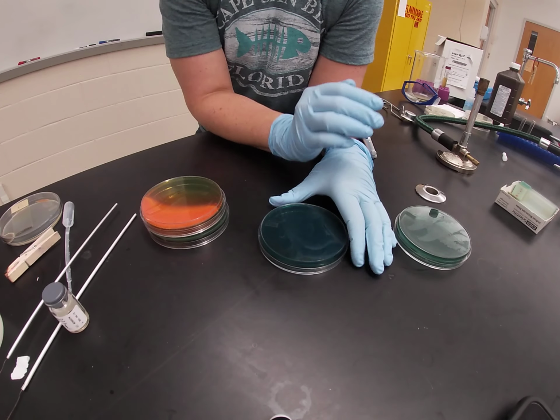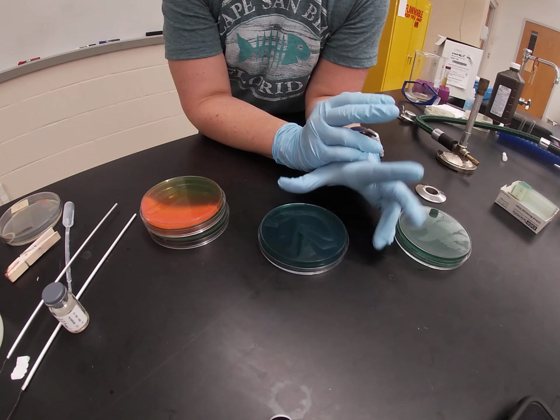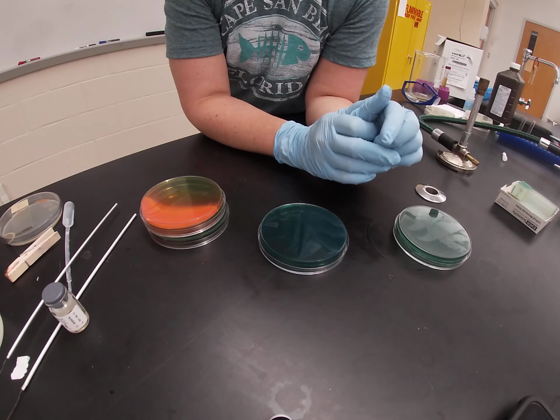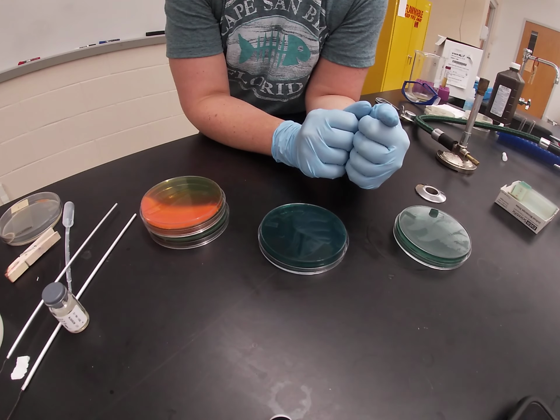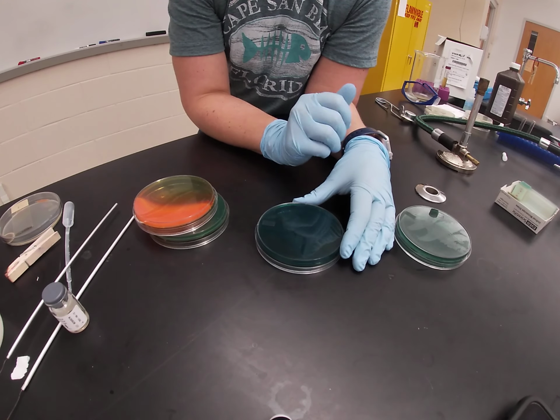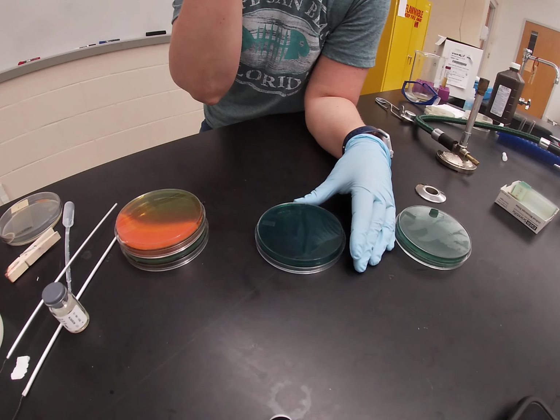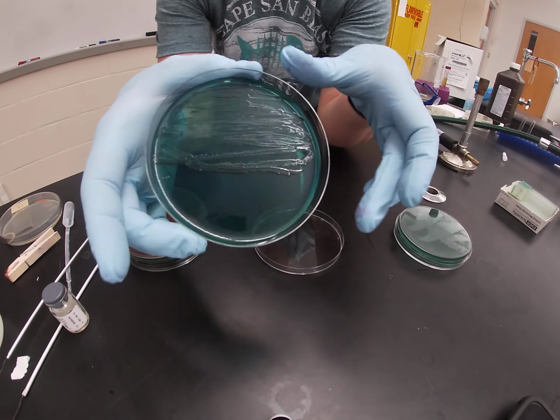This agar is also differential based on hydrogen sulfide gas production. There are 2 different things in this media that allow the production of this gas. There is sodium thiosulfate, which works as a sulfur source, and there is ferric citrate, which works as an indicator. If organisms are able to take that sodium thiosulfate and break that down into hydrogen sulfide gas, the hydrogen sulfide gas is going to react with the ferric citrate to produce a black pigment.